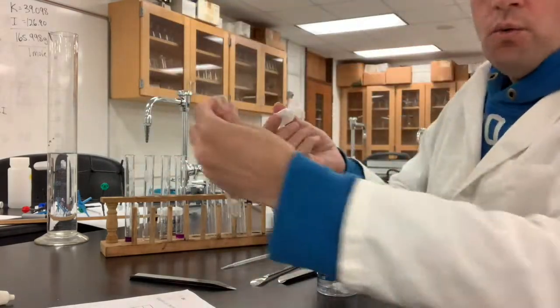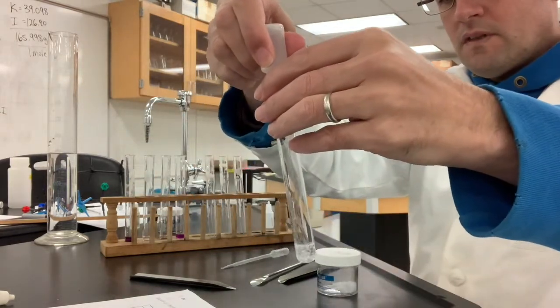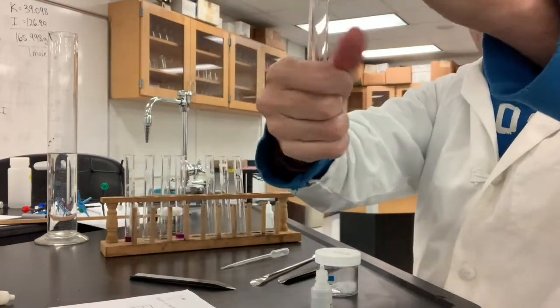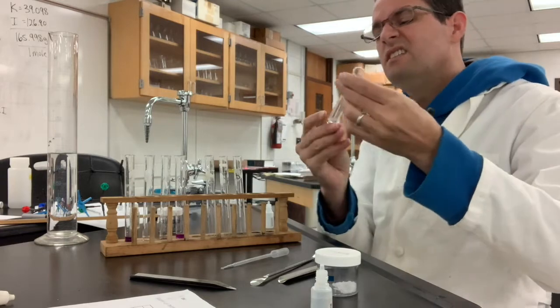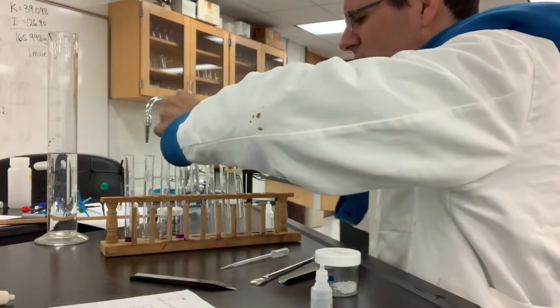Water is on the left, so I'll put some water in here, and we will try to warm it up. Remember, it's more soluble if it's warm, and it takes a while to do its thing, so we'll come back to that.